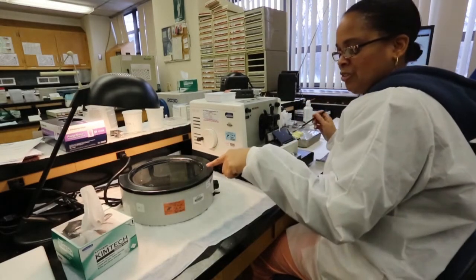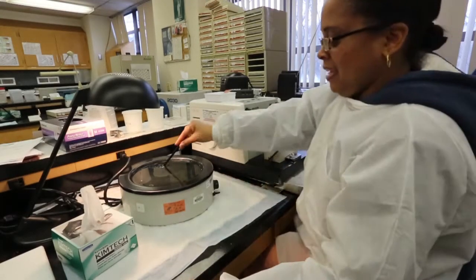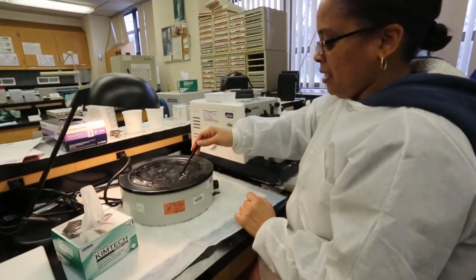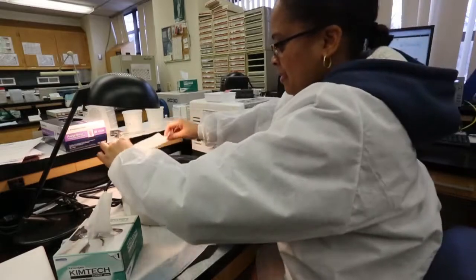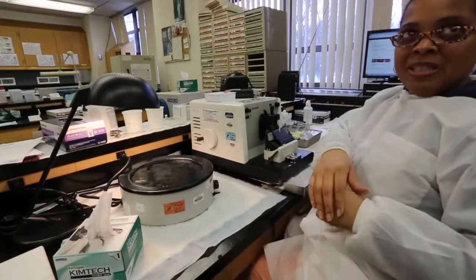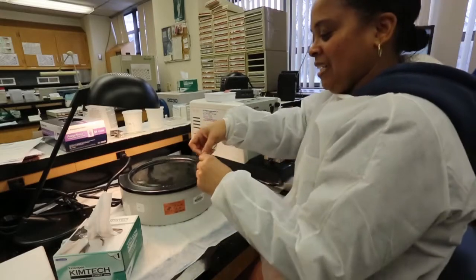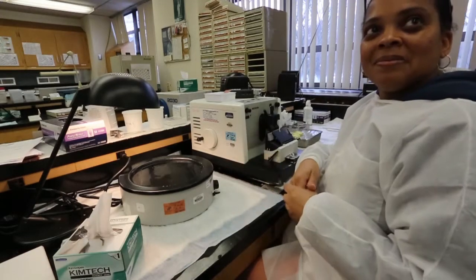The first thing you want to do is make sure you use DI water, because it's cleaner and it doesn't have a lot of static. I'm getting the bubbles out so that they won't go under the slide when I try to pick up a section. If I were to put regular water in there, I would know because when I lay a ribbon down, it'll start moving around — because it's more static, it would move.